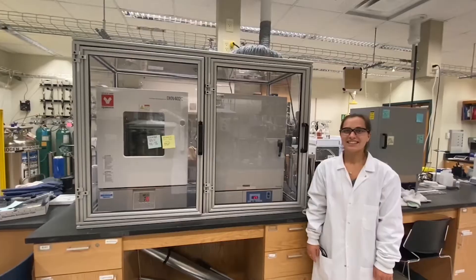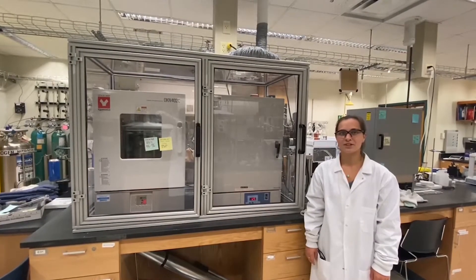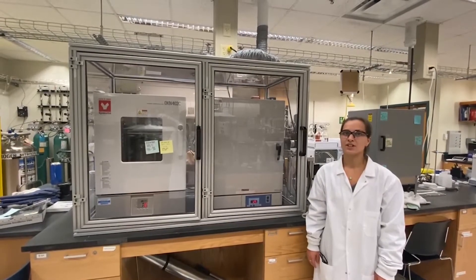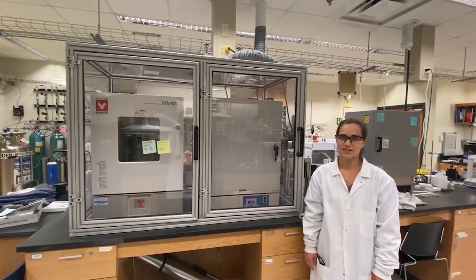In this lab, we have two synthesis ovens that are used for the crystallization of zeolite materials under either rotating or static conditions.